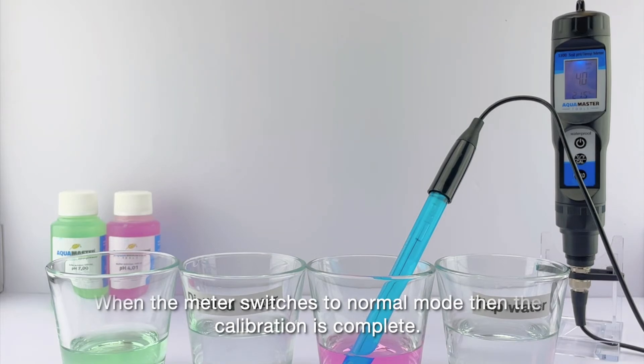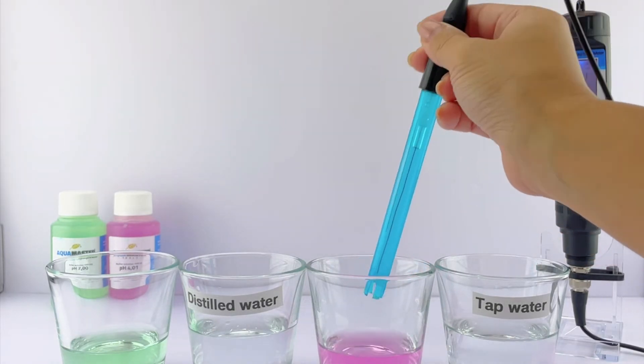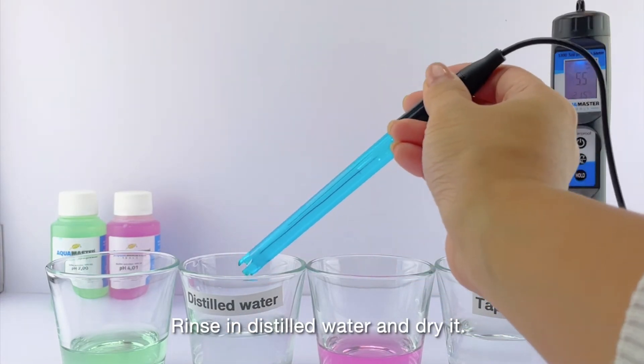When the meter switches to normal mode, then the calibration is complete. Rinse in distilled water and dry it.